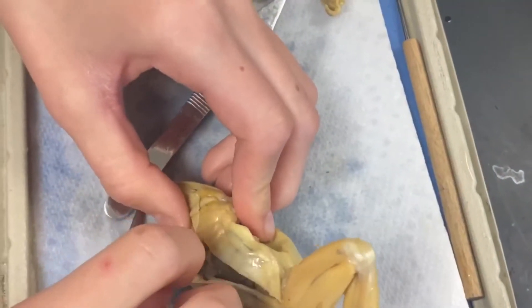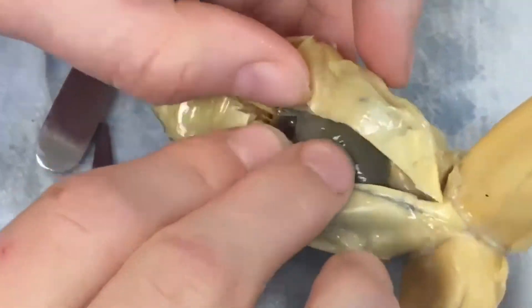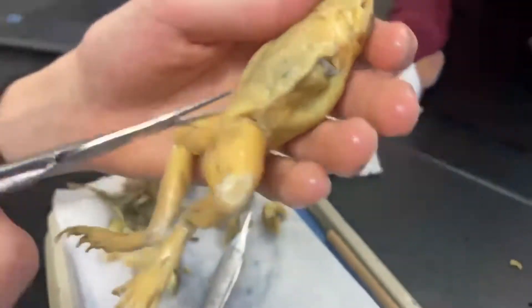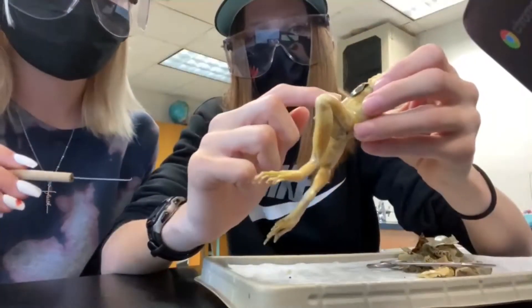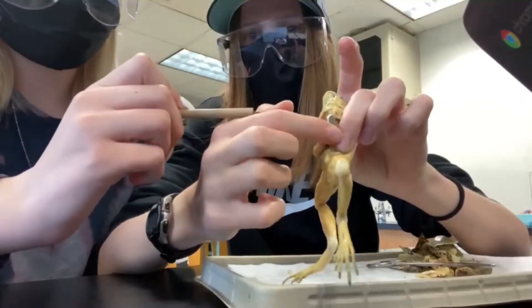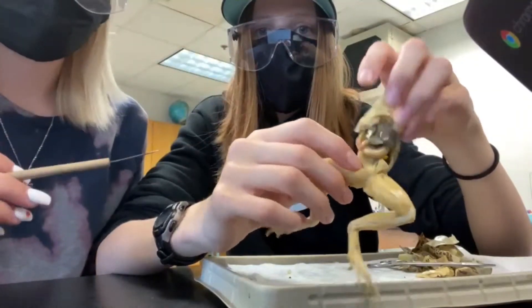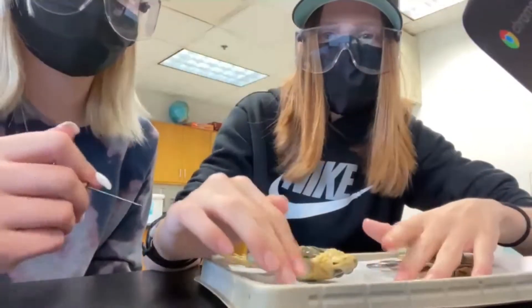The liver — it's dark colored. Can you cut away some of the skin? Look at that, right there. That's the other side. Open that up again so we can see it. This is the small intestine... this is the liver. And right here is the large intestine. And isn't that the bladder right there? Yep, the bladder's right there. And we need the small intestine. She's drippy.